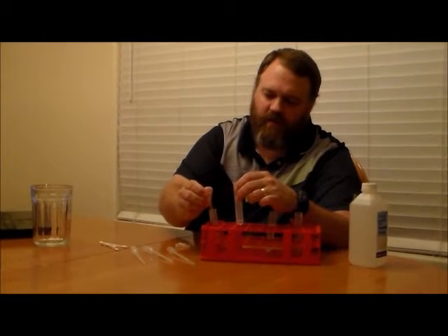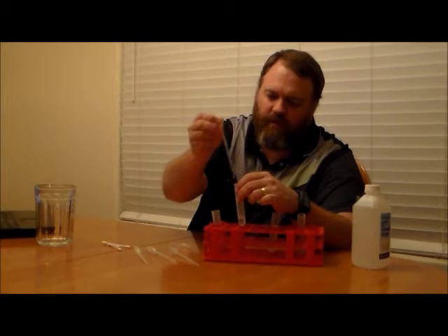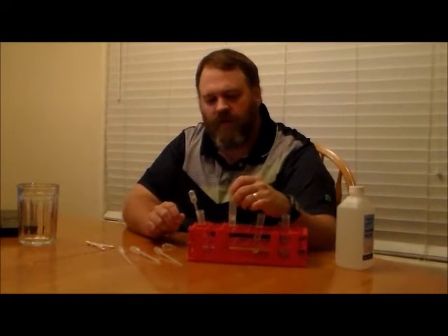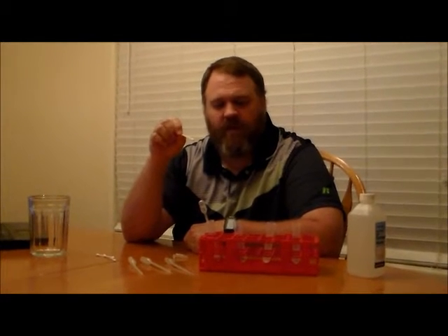I'm going to add 1 to 3 milliliters of the soapy solution. Now we have our soapy solution, but we need to put some cells in there. So what you're going to do next is take about 3 or 4 clean cotton swabs — just Q-tips from your bathroom. We're going to collect cells from the inside lining of our cheeks, called buccal swabs. I'm going to rub them pretty vigorously on the inside of my cheek because I want to collect a lot of skin cells.